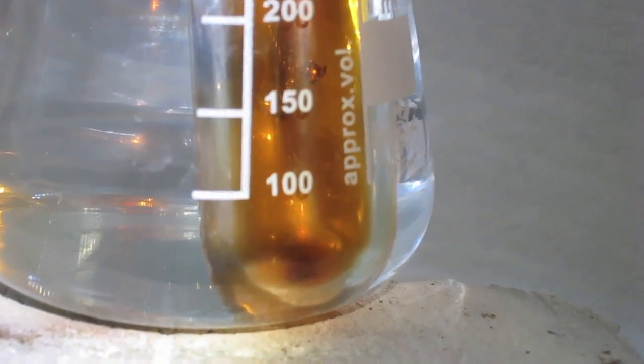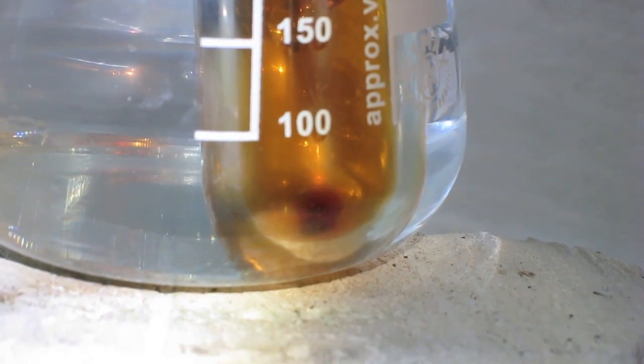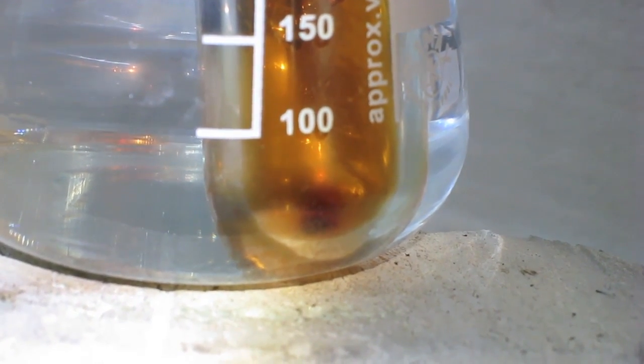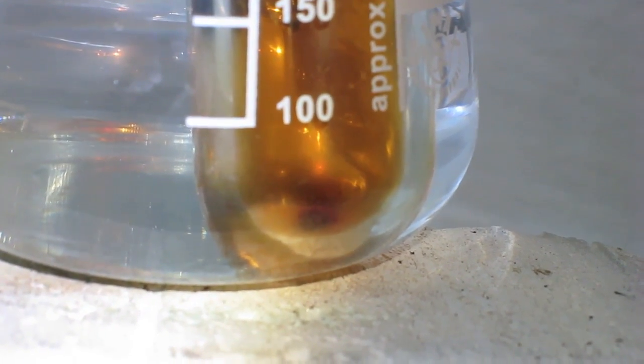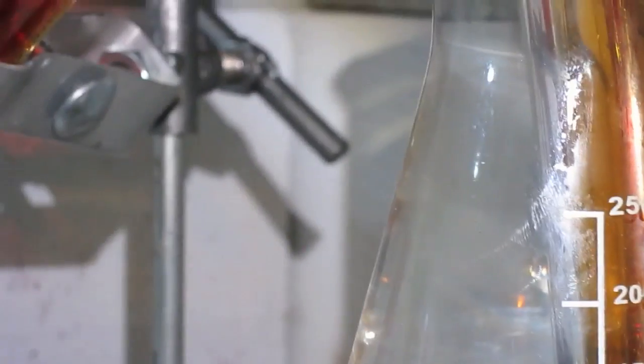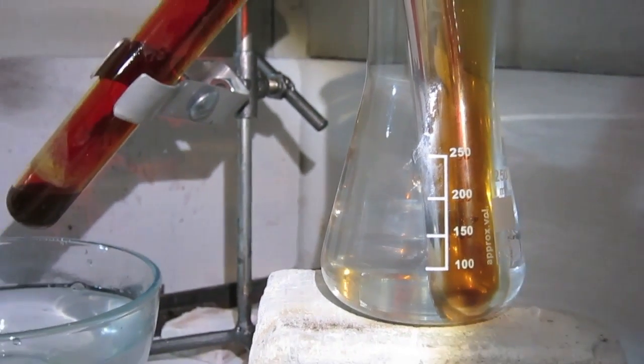I am going to see. Yes, I have seen some black stuff appear with dark color, and some liquid bromine. I zoom out, and that is going to be the end of this.